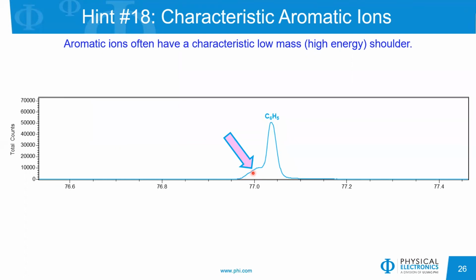The reason that I bring up these two examples, the high mass shoulder for the silicones and the low mass shoulder for some of the characteristic aromatic ions, is that if you're trying to optimize your sample bias for an insulating specimen, you might look at this and say that your sample bias isn't quite correct. But what I would recommend is that you look at other ions and make sure that the peak shape is symmetric to get your sample bias correct for that insulator analysis. Sometimes it can be misleading to look at some of these aromatic ions for that.